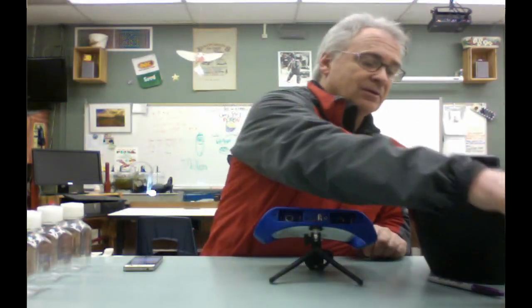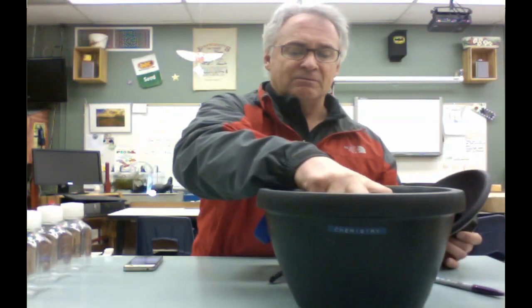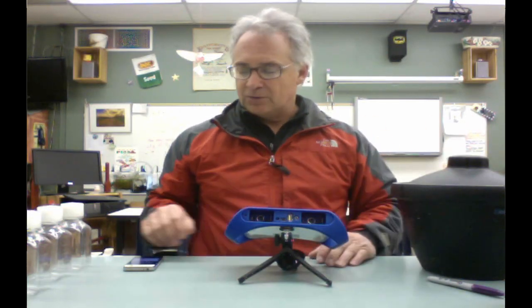We're also going to need 3 different groups of pea seeds. You're going to need dormant seeds. You're going to need seeds that have been soaking in water at room temperature for the last 24 hours. And of course, you're going to need some seeds that have been in ice for 24 hours as well. So those are the 3 treatments that we're going to be looking at, and we're going to see how the cellular process moves forward based on temperature and what gas is given off, oxygen or CO2.